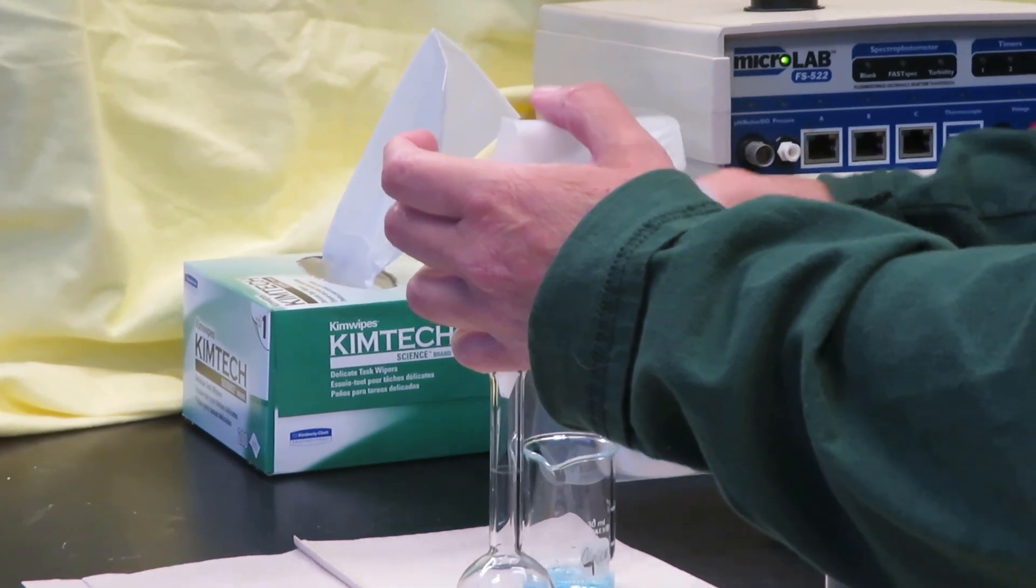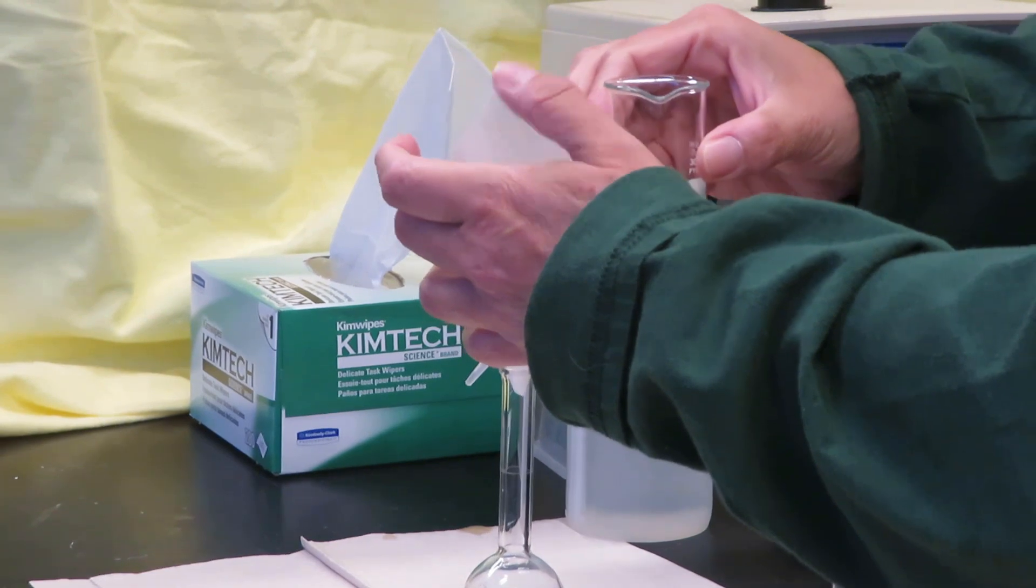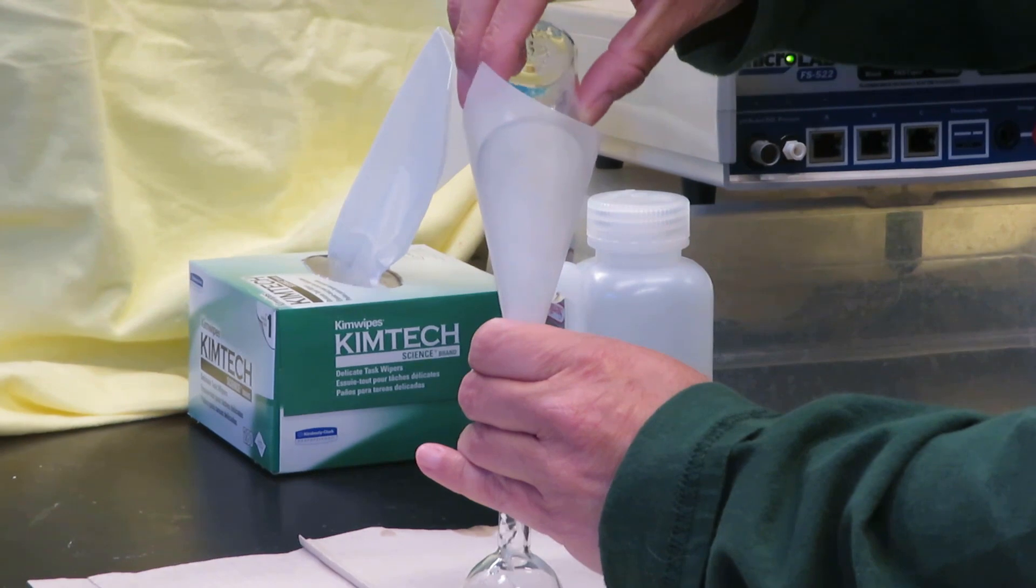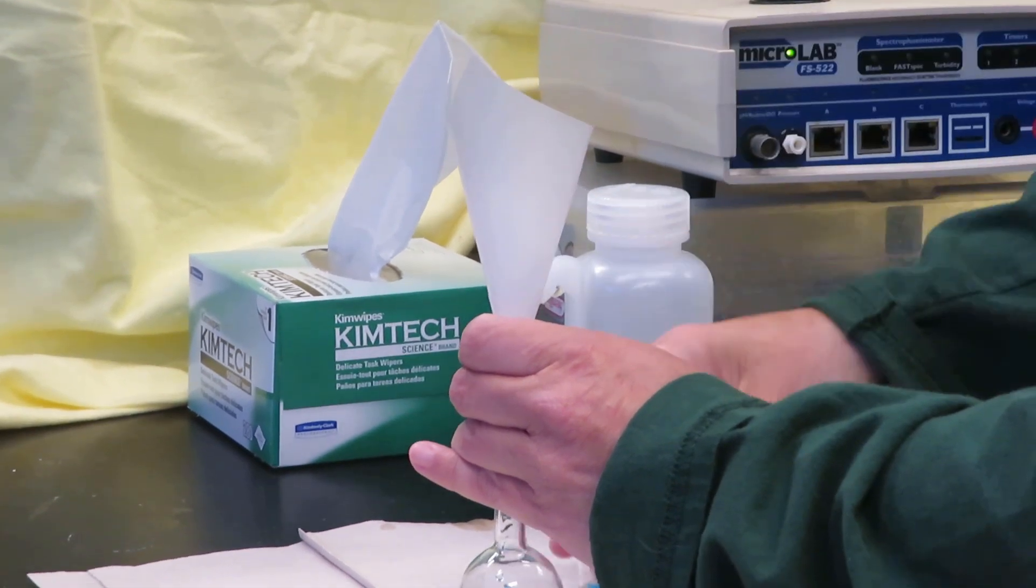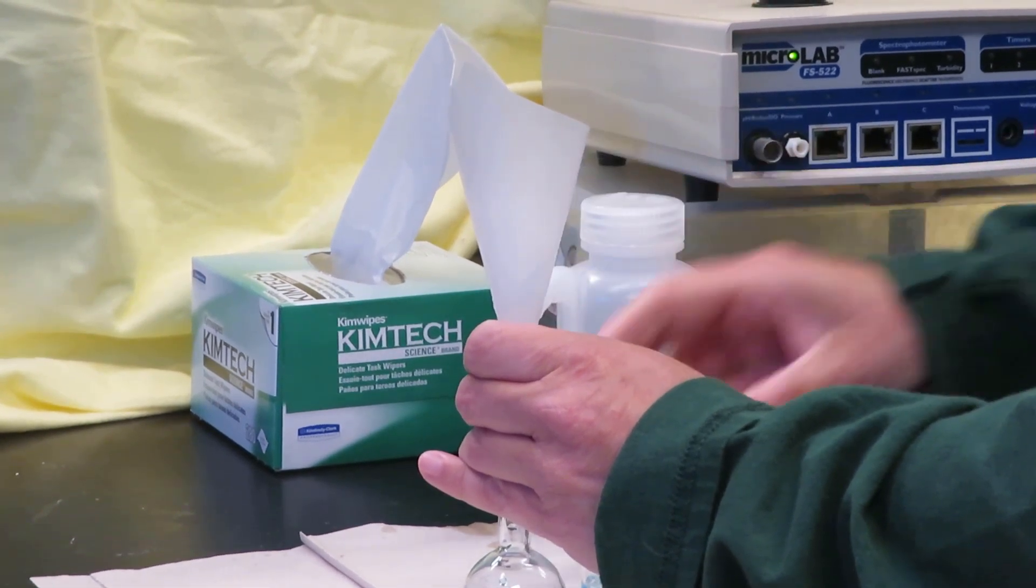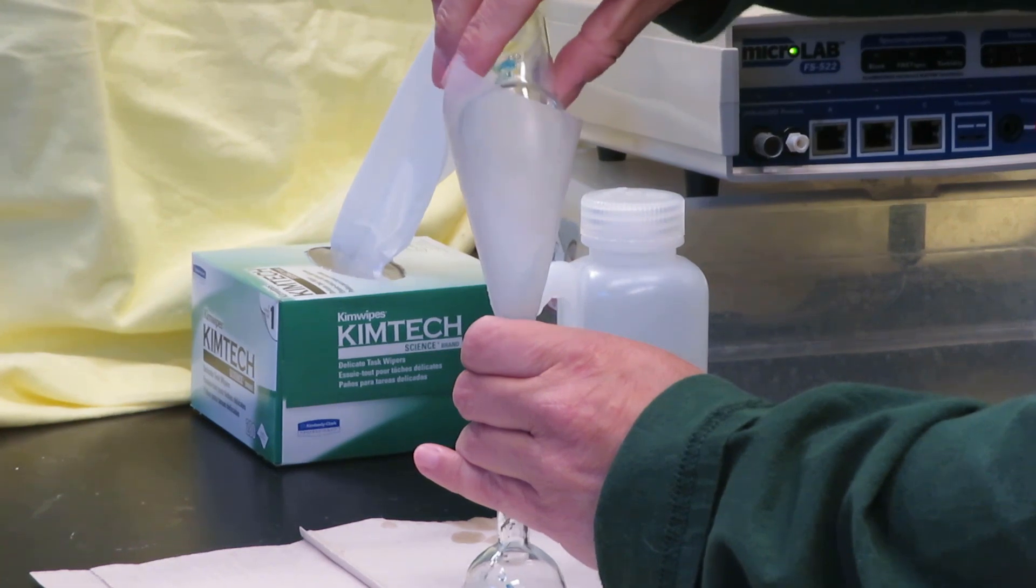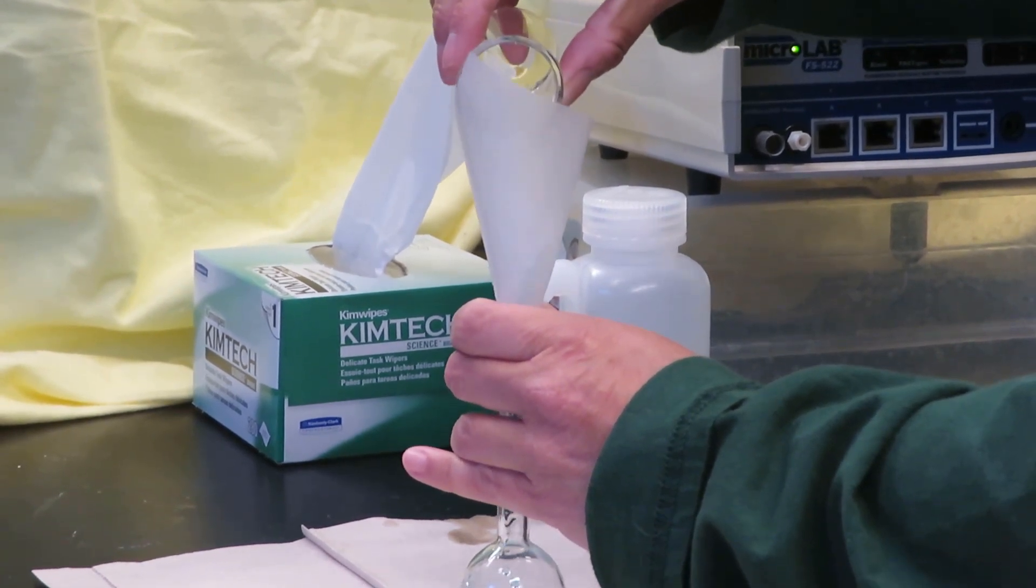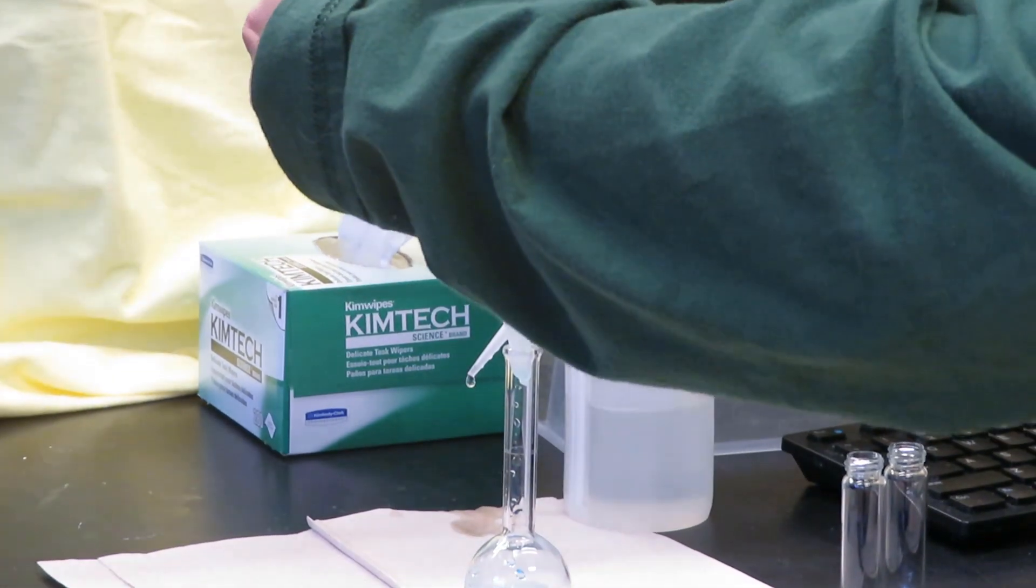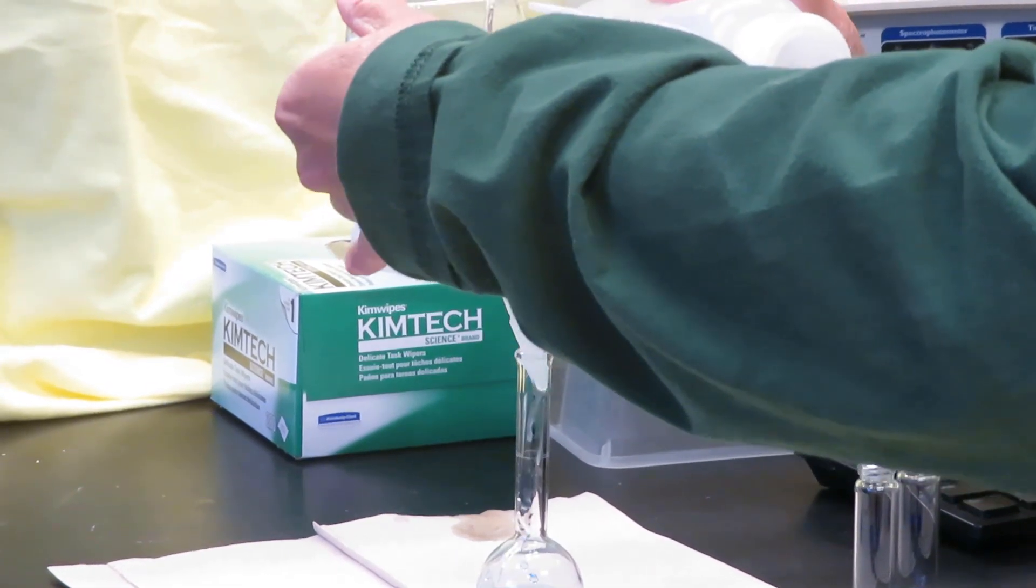I'm going to add some water to help with the transfer, being careful not to add too much water. And I need to do some more. It helps to tilt it.